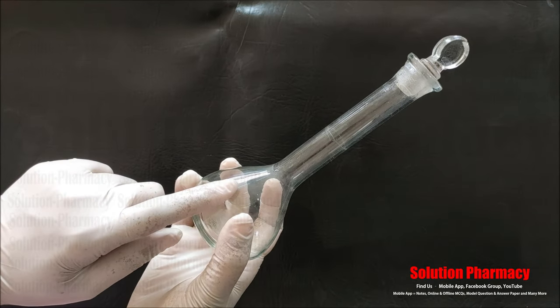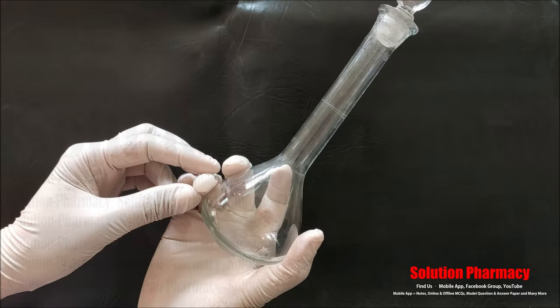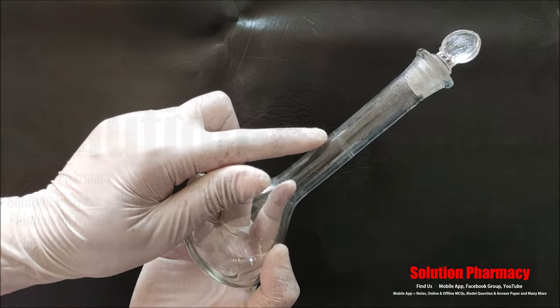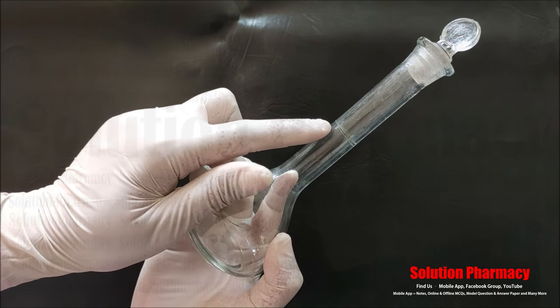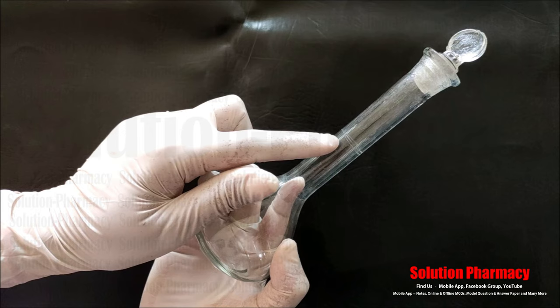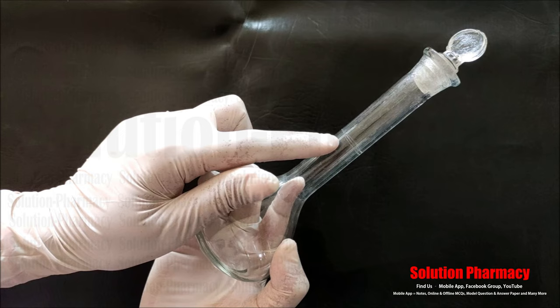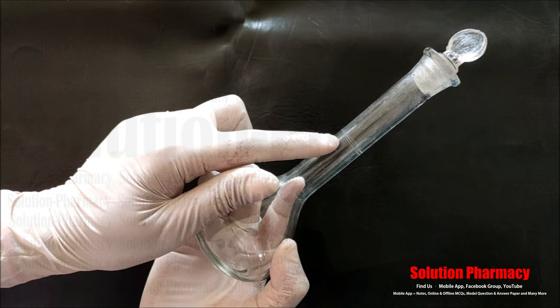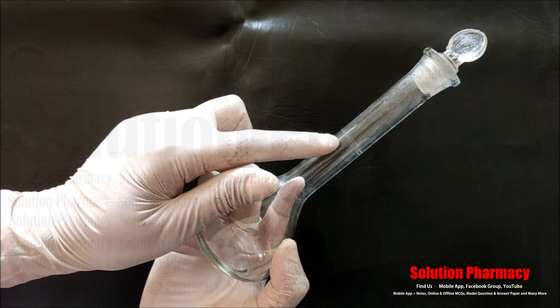Next, this glassware is called a volumetric flask. You can see the bottom is bulb-shaped with a flat base and a long narrow neck. It is marked with a graduated line. This volumetric flask is 100 ml, so to prepare the solution we add solute into the volumetric flask, then add solvent, mix it, and fill with solvent up to the mark to prepare exactly 100 ml of solution.